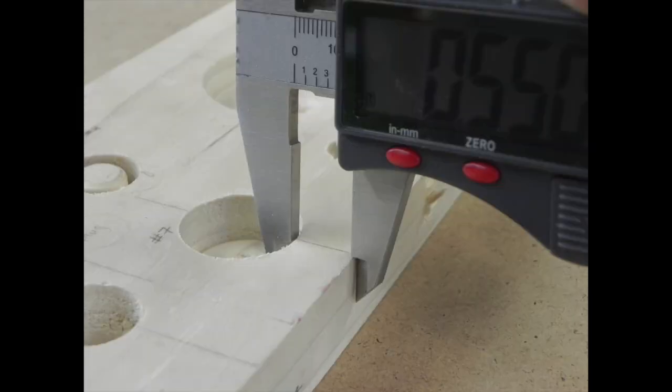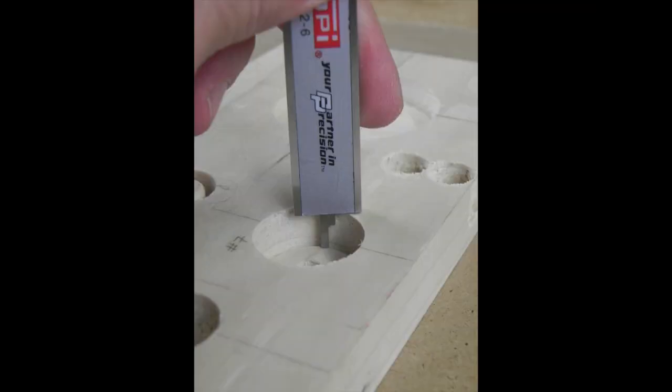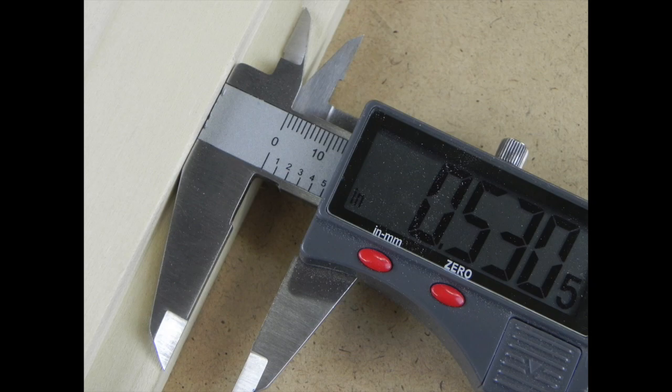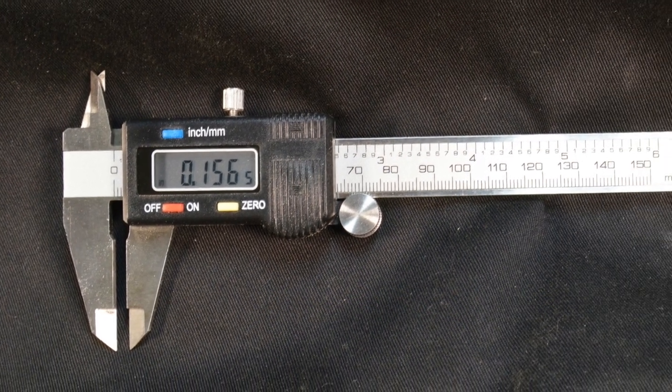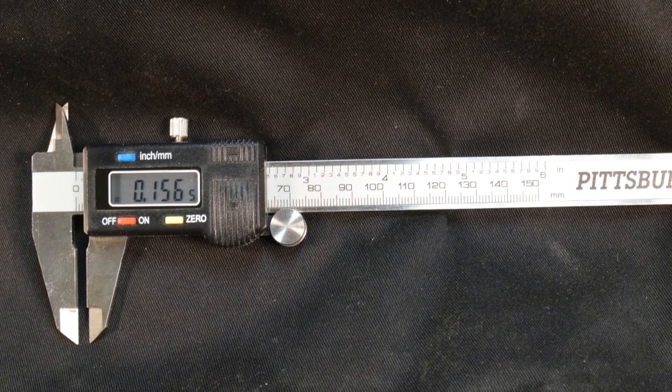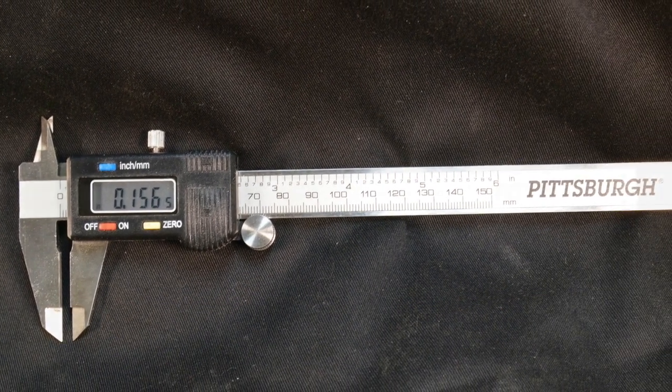Slide calipers have become popular in recent years and are useful for making accurate measurements. Calipers consist of a number of parts. In this presentation, we will focus on battery-operated digital calipers.